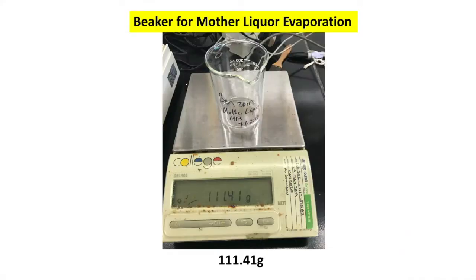Now I'll perform another little side experiment. The crystals grew in the ethanol, and we call that the mother liquor because the crystals were born in the ethanol, which is the alcohol of liquor. So I'm going to take the mother liquor and pour it into this beaker and then allow it to evaporate to see how much solid is left over. It should have the thiamine hydrochloride catalyst and some benzoin that we didn't get to crystallize. So just to see how things are going, I'll do that on the side.